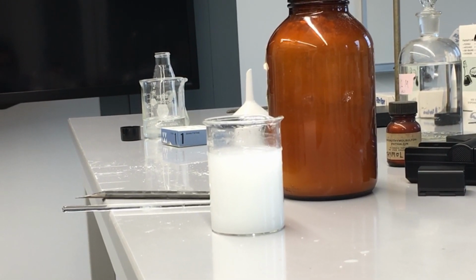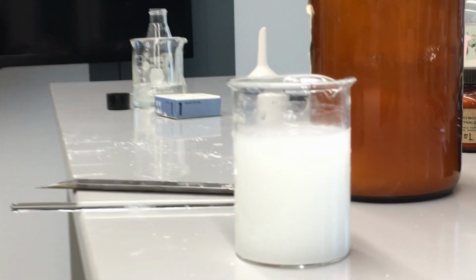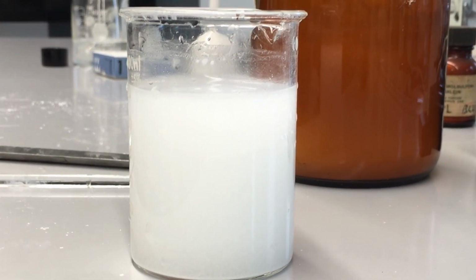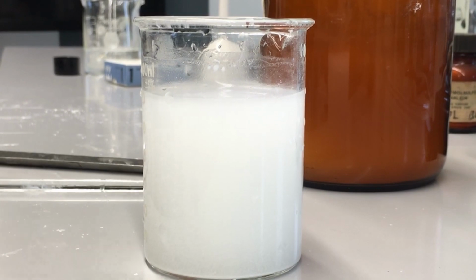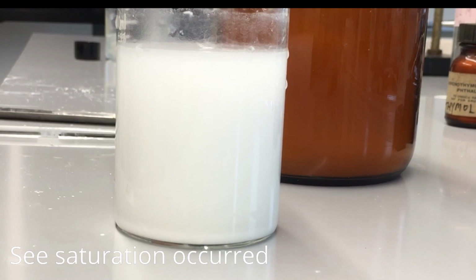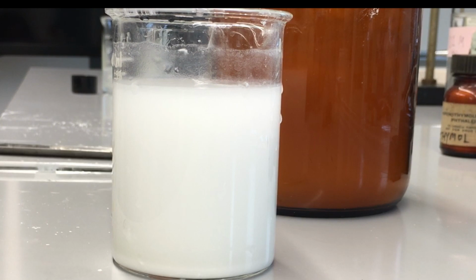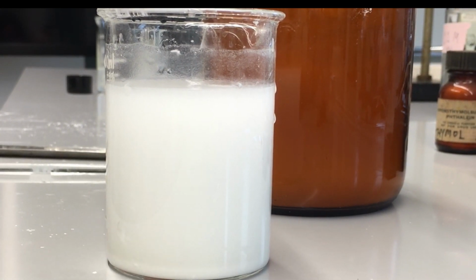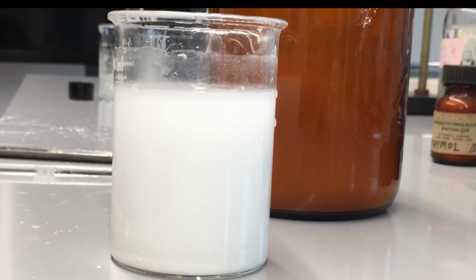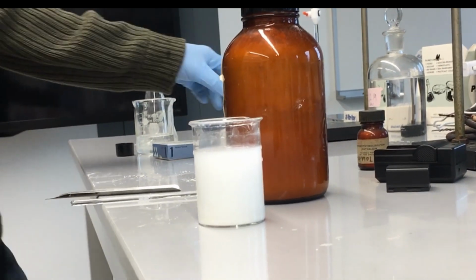So once we mix it in and we let it settle for a bit, if we start to see some solid calcium hydroxide form and an aqueous layer form on top of that, that's how we know we've reached the saturation point. We've added a little bit more calcium hydroxide here. You can see the solution is still fairly opaque. But if we go down to eye level, we should start to see a separation of the aqueous components, the aqueous calcium and aqueous hydroxide ions, on top of our solid calcium hydroxide.